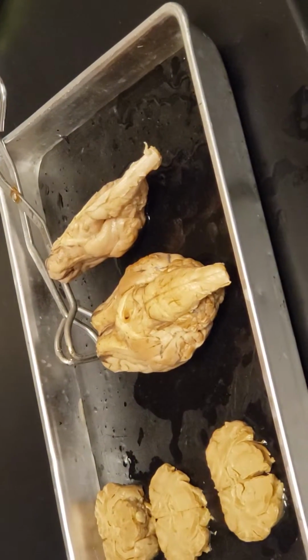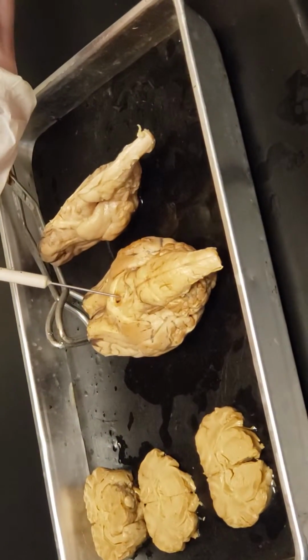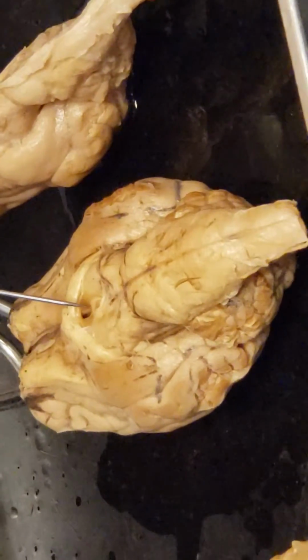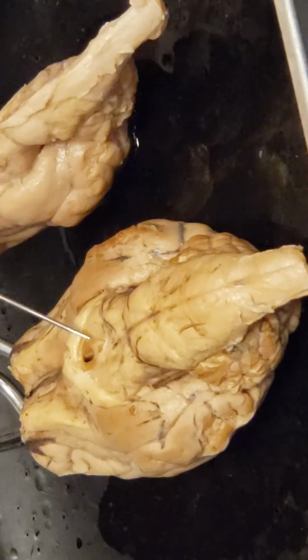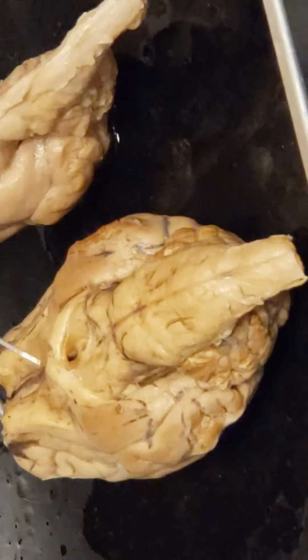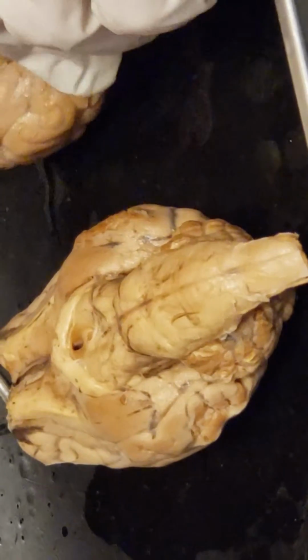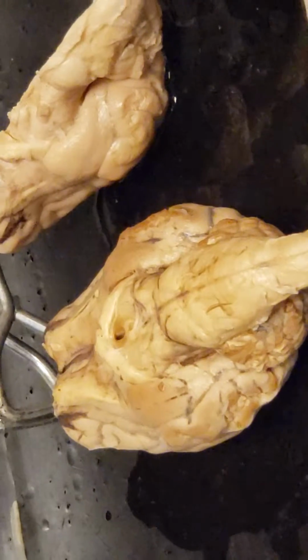Optic chiasm, optic tract. The mammillary body. So the mammillary body is kind of right down here. It's sort of been pinned before, and so you can see a little bit of a hole, and that regulates our sucking reflex that we're born with, and so that's the mammillary body right under there. Let's see if I can see it. I can't really see it in this guy. This is the mammillary body.